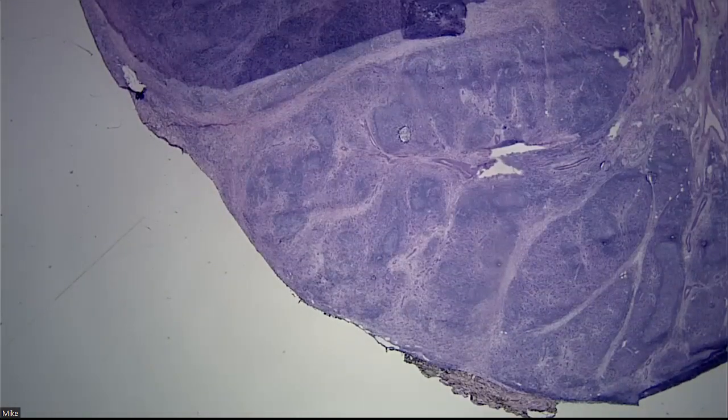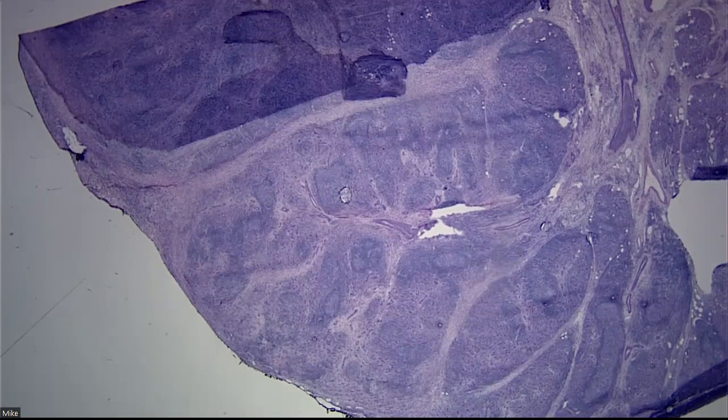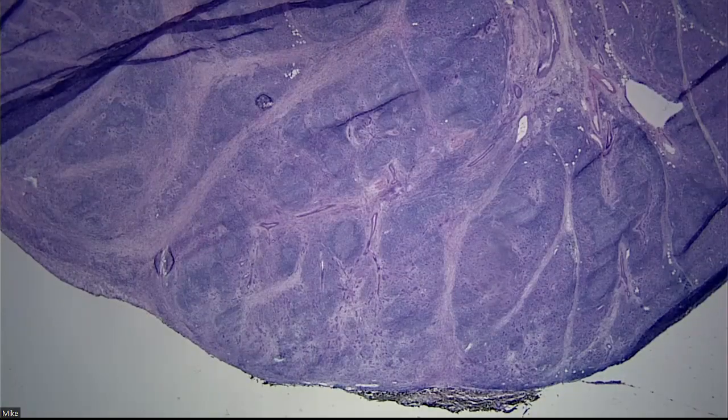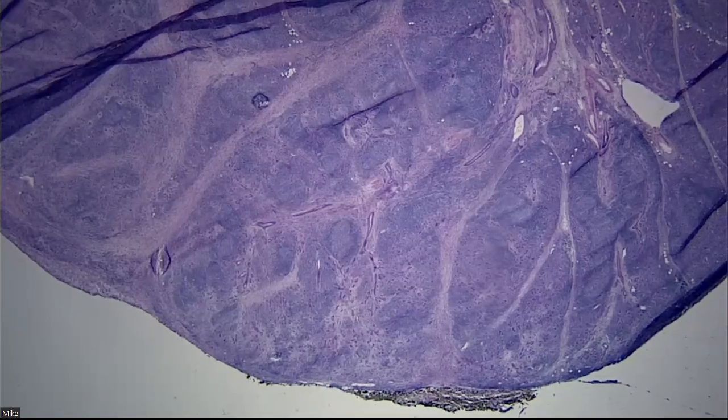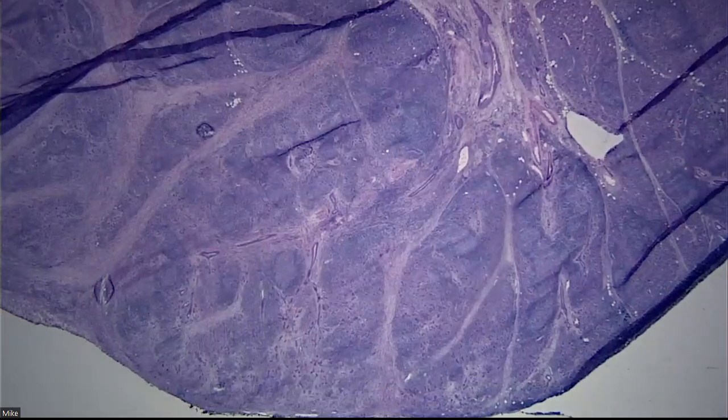This is a 44-year-old male with a history of left submandibular swelling, which came on 8 months ago and has not resolved. No stone on CT scan, but enlargement.